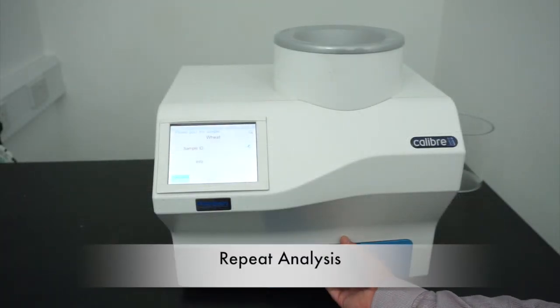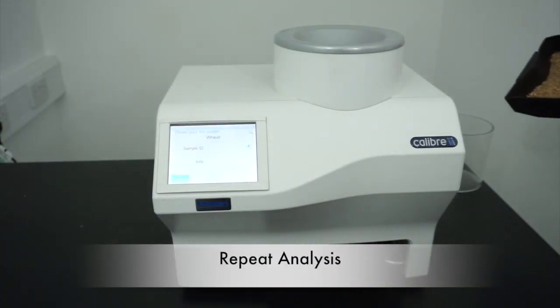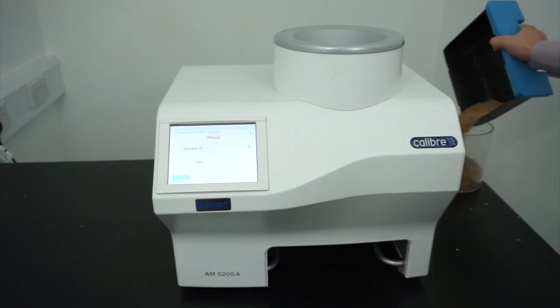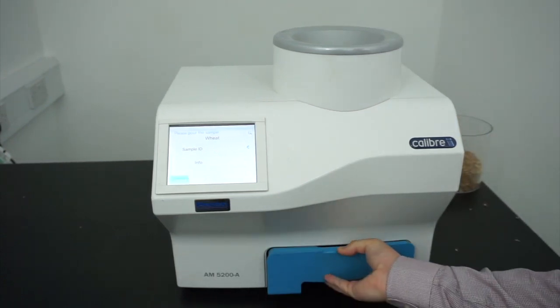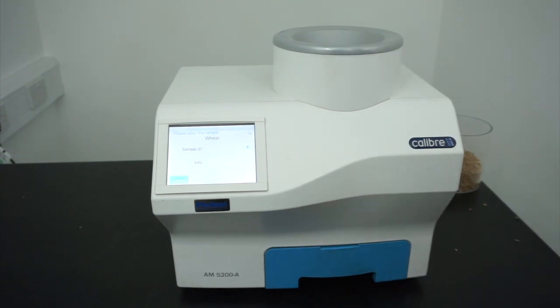To analyse your next sample, simply empty the sample drawer. Replace it into the instrument and fill your next sample.